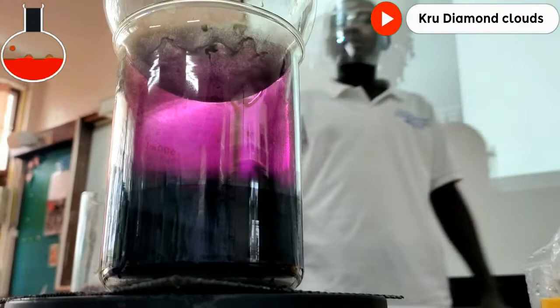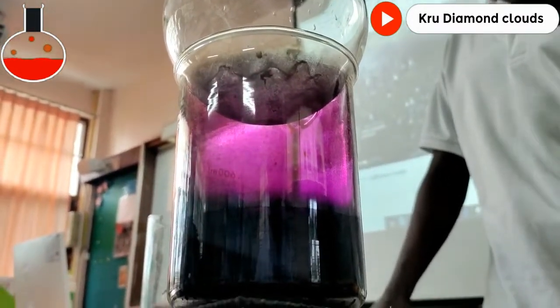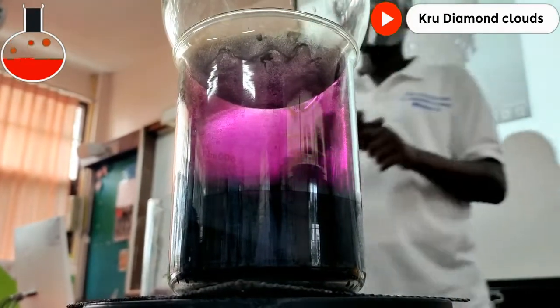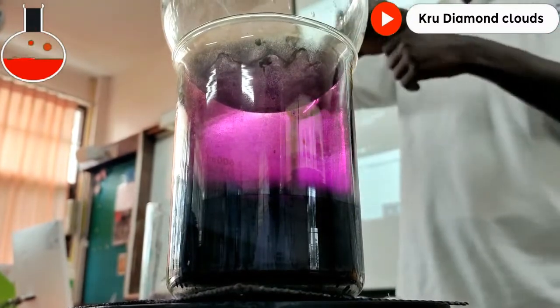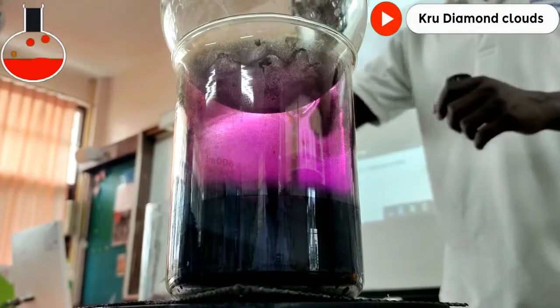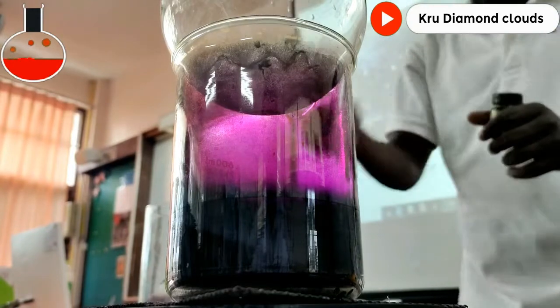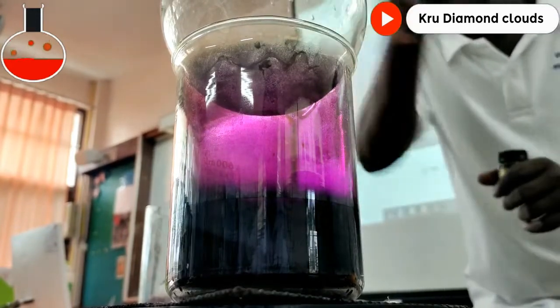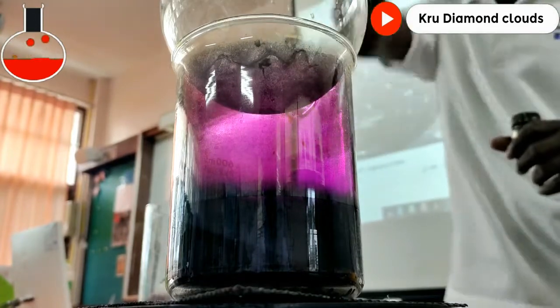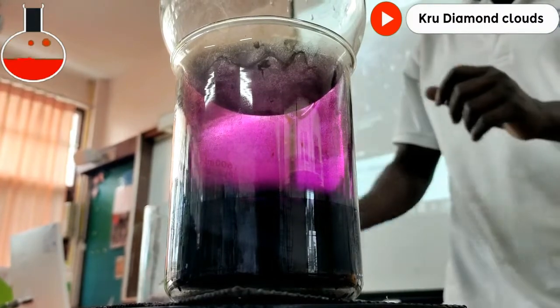The first thing was sublimation — sublimation is when solid changes to gas. We did that already, because this iodine crystal is initially solid, and it changed into the gas that you can see. And then the gas also changed into solid crystal. So two things happen here: sublimation, solid to gas; and the one we are waiting for is deposition, gas to solid. Sublimation and deposition at the same time.